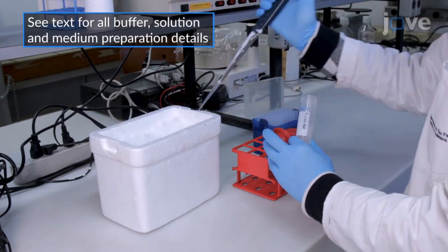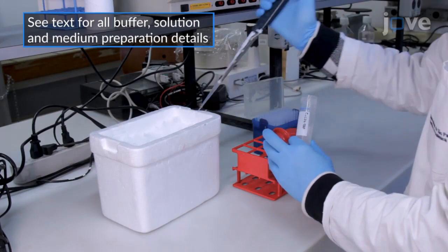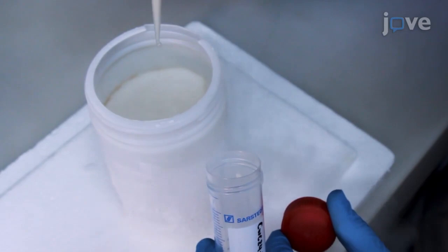After the second wash, resuspend the cells in one-tenth of the cell volume of cold buffer A and freeze 50 microliter drops of the yeast cell suspension in liquid nitrogen.